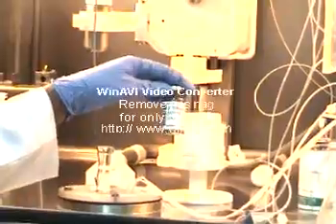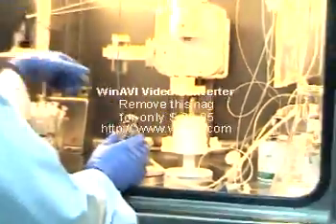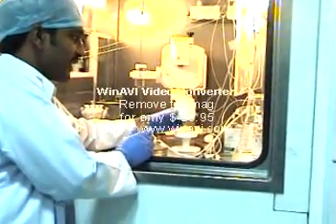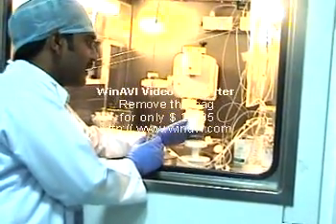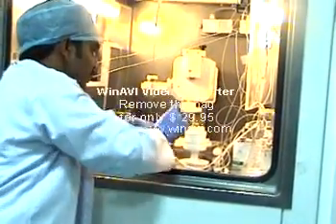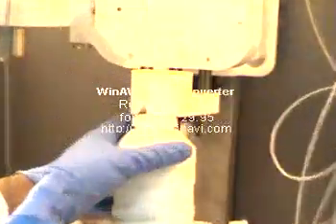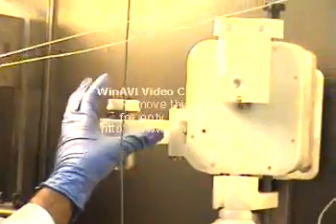Keeping that in mind, we will allot the dose to the patients. What you are seeing — the white one — is a sterile vial holder. We will place the vial inside this and close it. This is a self-automated dispensing system, also called a syringe filling station. We fill the syringes using this, by using the manipulators, standing outside the shield.